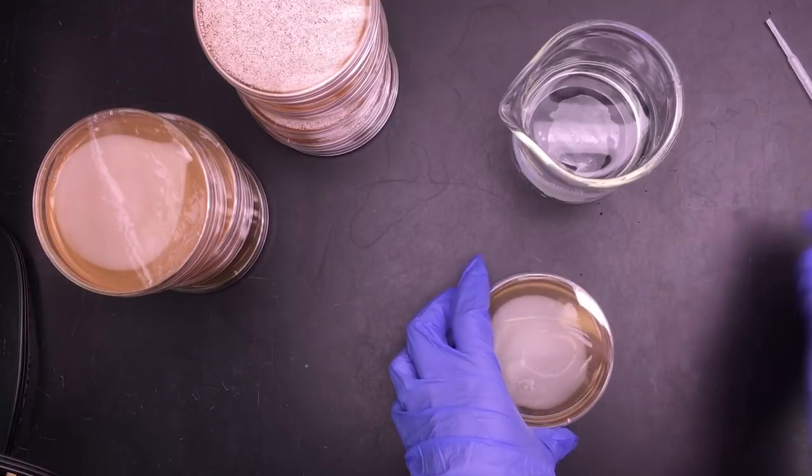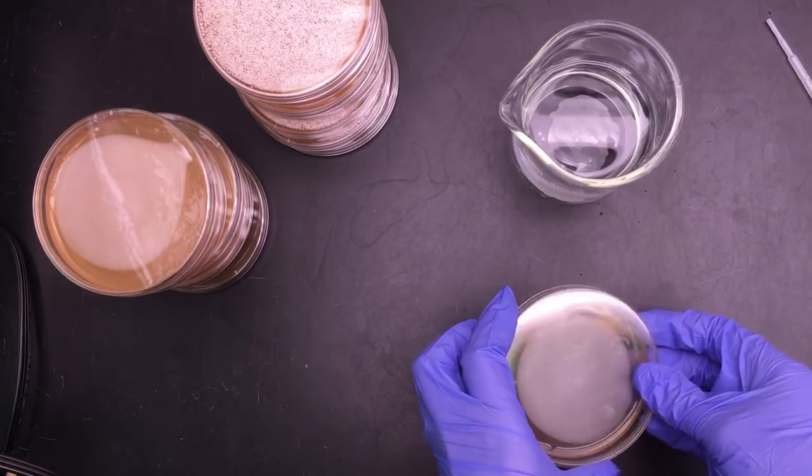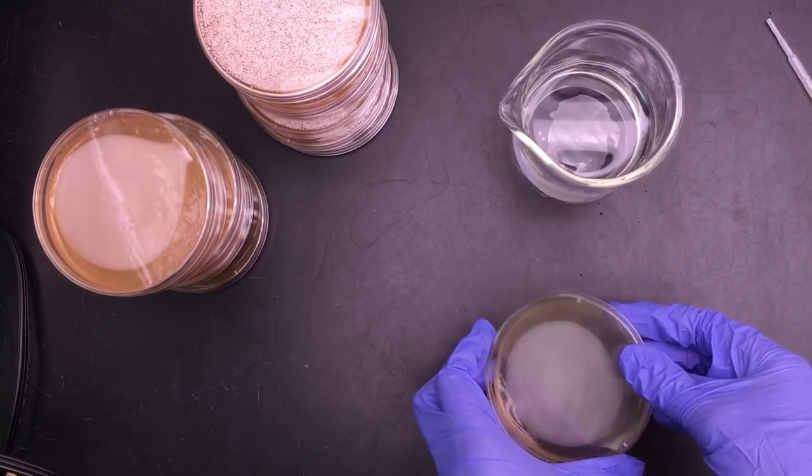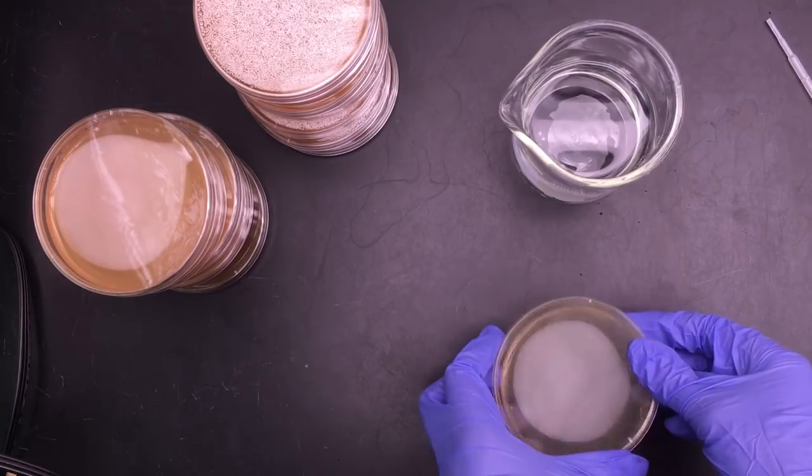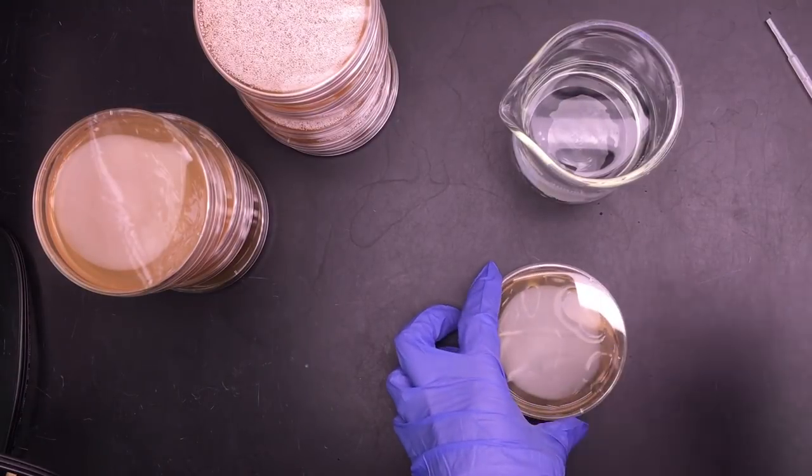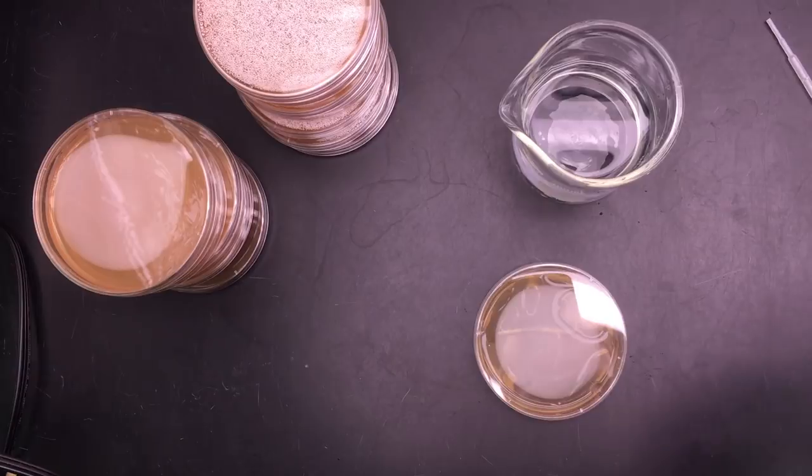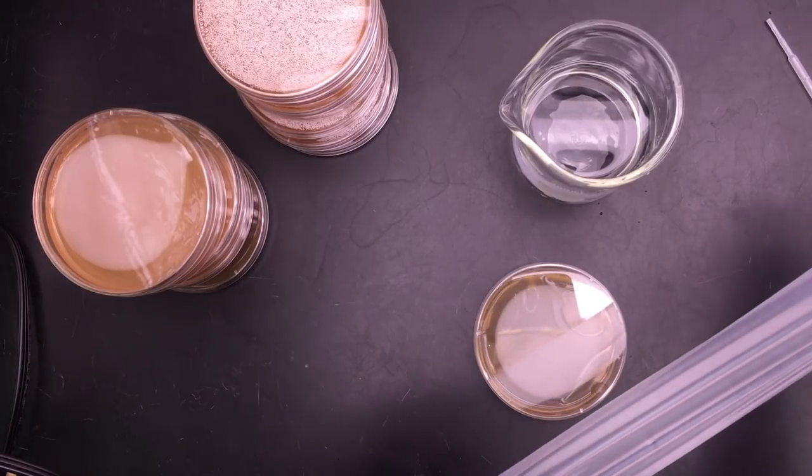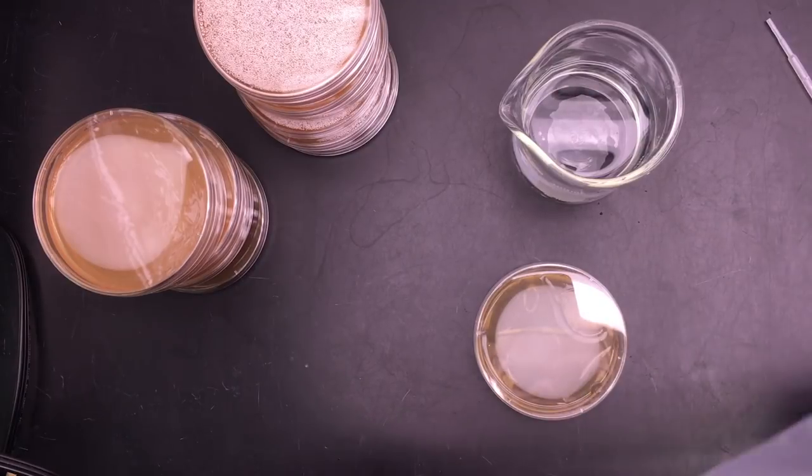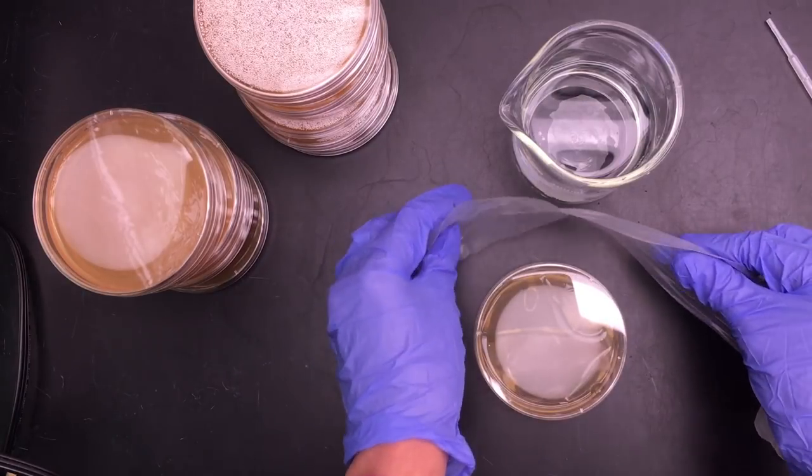You'll notice that I am careful not to leave the lid off too long on a petri dish and that's really important to prevent contamination from the air from getting inside of the petri dish. And I'm going to seal it and label it.